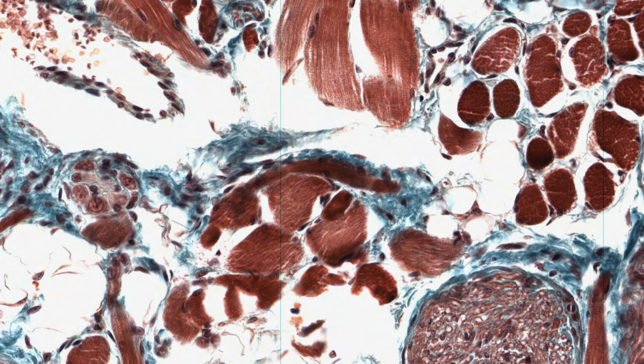Some will only have several axons. And if you look hard enough, you can see this very small parasympathetic ganglion. It is really only a few parasympathetic second neuron cell bodies. It will be regulating the activity of some of the extensive glands in the tongue.